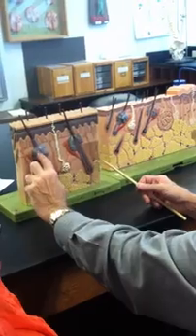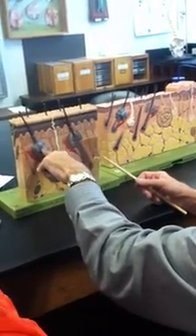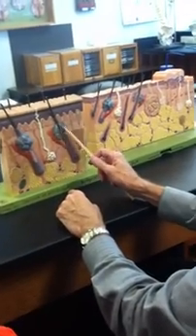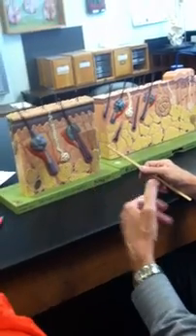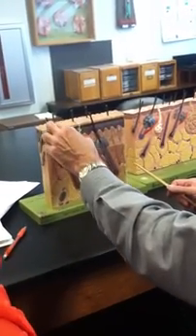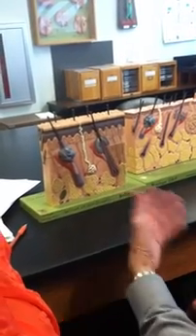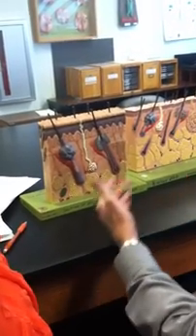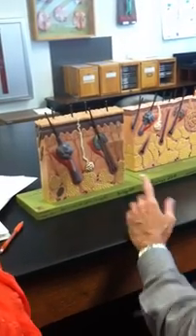Wrapped around the follicle, always, every follicle has one of these wrapped around it, is a sebaceous gland. In sectional view, you can see this chopped sebaceous gland. This is the source of sebum. Sebum is an oily secretion. Sebum moves its way up along the hair root and shaft, and so somebody with oily hair or oily skin has overactive sebaceous glands. Somebody with dry hair or dry skin has underactive sebaceous glands.